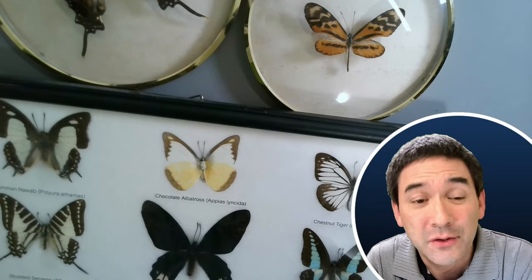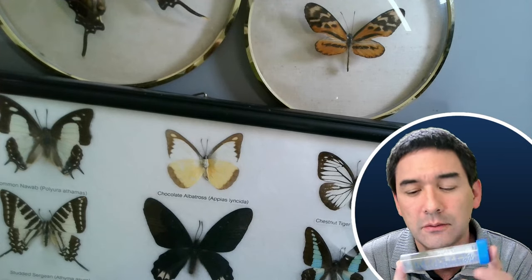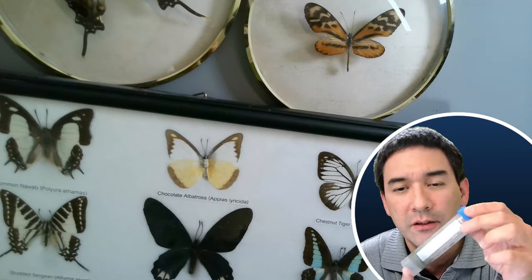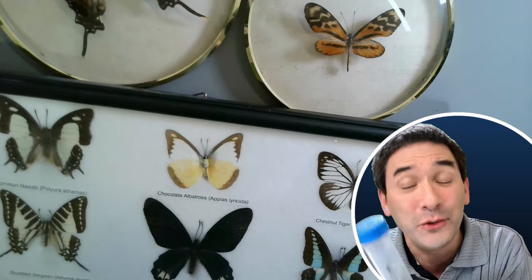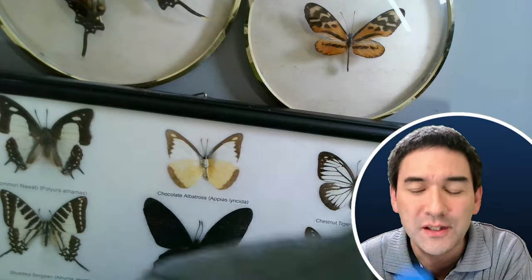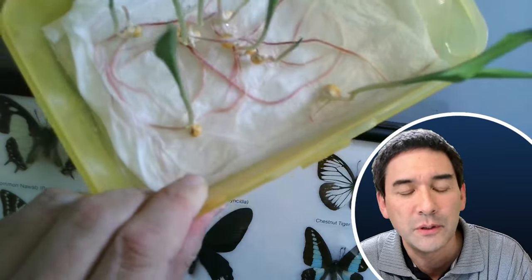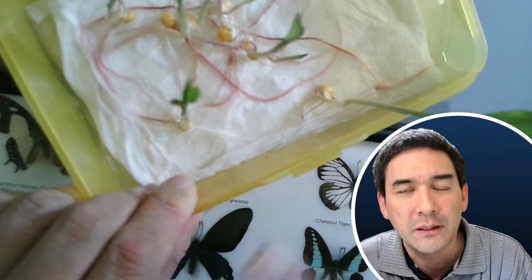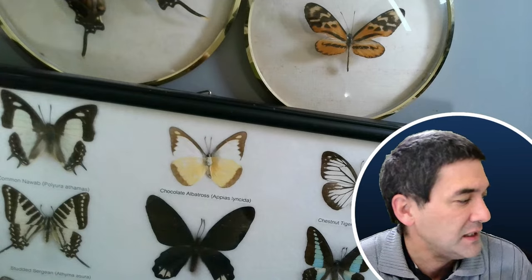I would also like to put some sand under the microscope. The sand sample I have contains a few interesting things. It looks like gold, but I will tell you right now it is not. I'm going to show you how to distinguish gold from pyrite, which is in here.